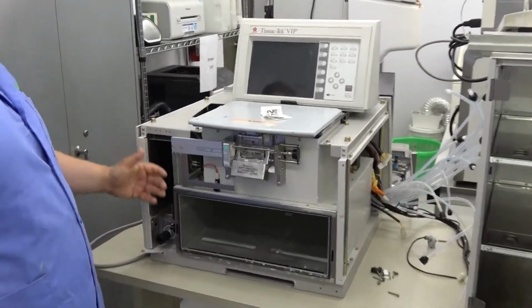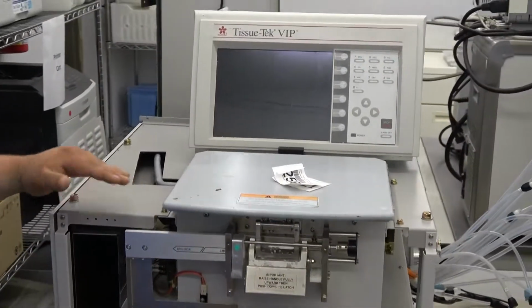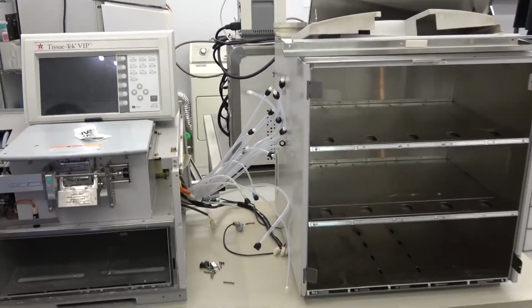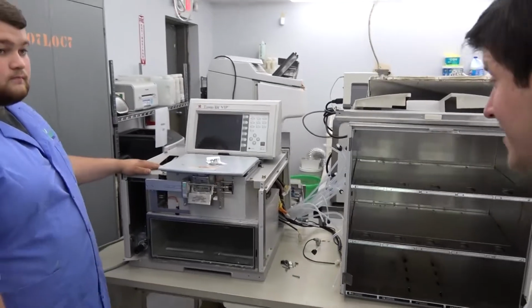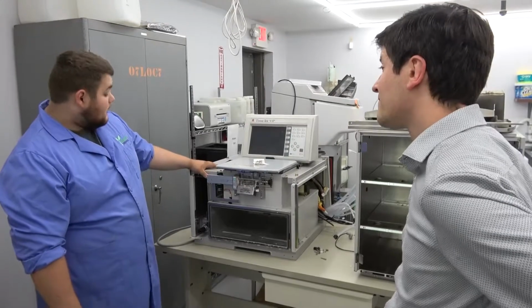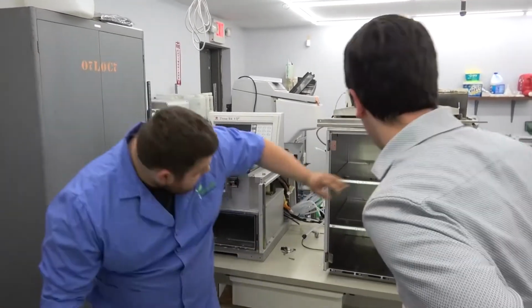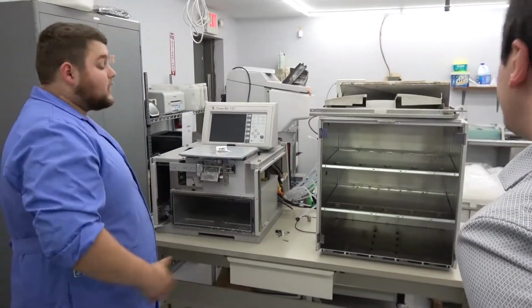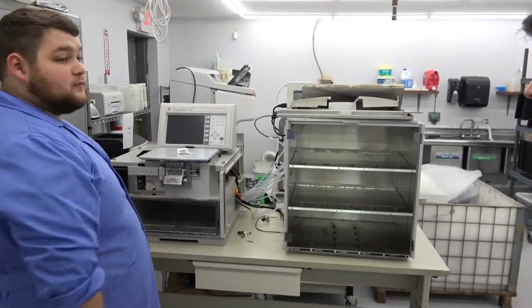We took the front door, the oven door, this front fascia, the top stainless steel. We took the doors off of this. We took a whole bunch of stuff just because it was in a lot better condition. So all that's really left of this that's useful is the door, the screen, and the rotary valve. Yep, for the most part. We still have panels and whatnot, and we still have the bottle manifold in here. There's definitely parts, but we just want to put our best foot forward and produce the best product we could.